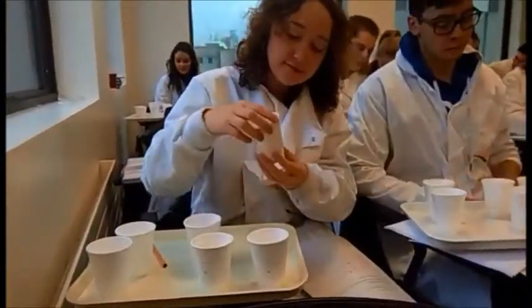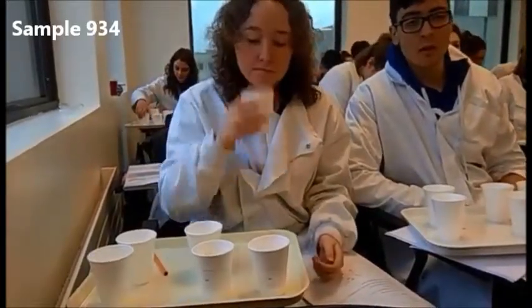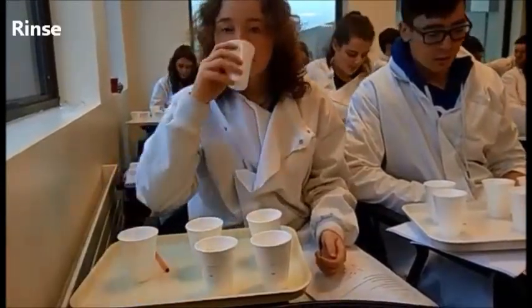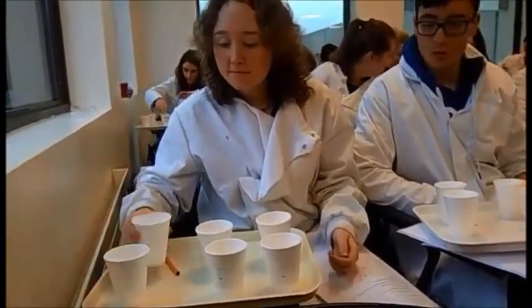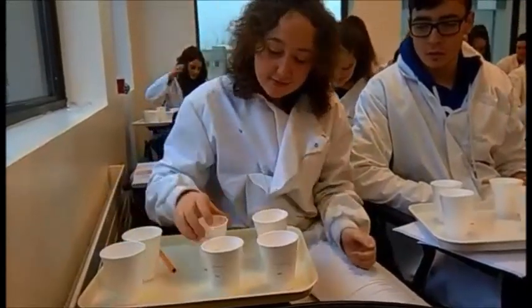She proceeds on to set 2. She tastes sample 934. She rinses with water and she spits the sample back into the cup.